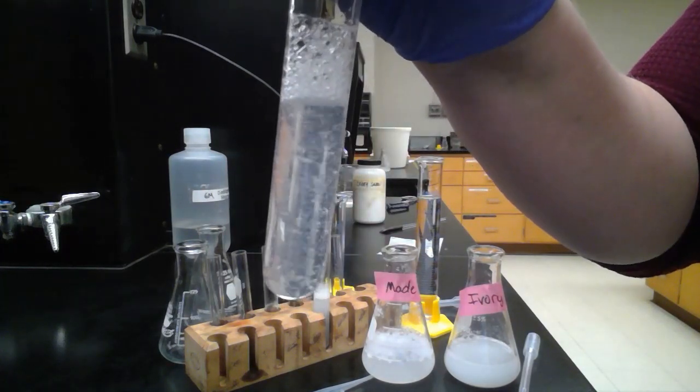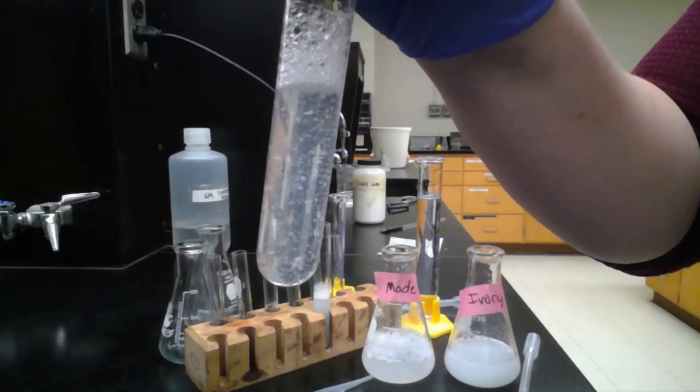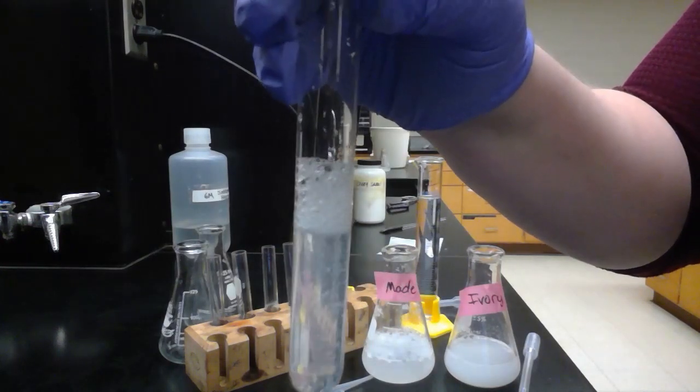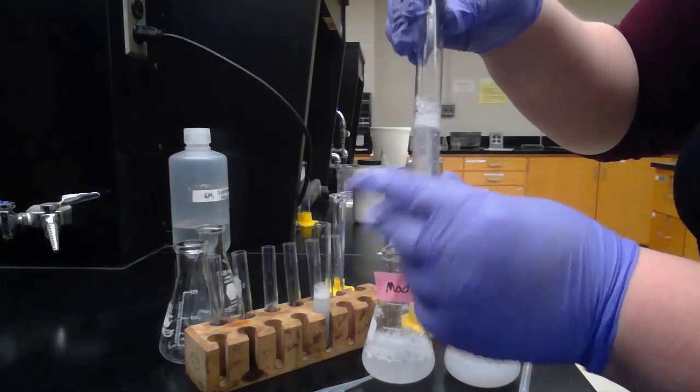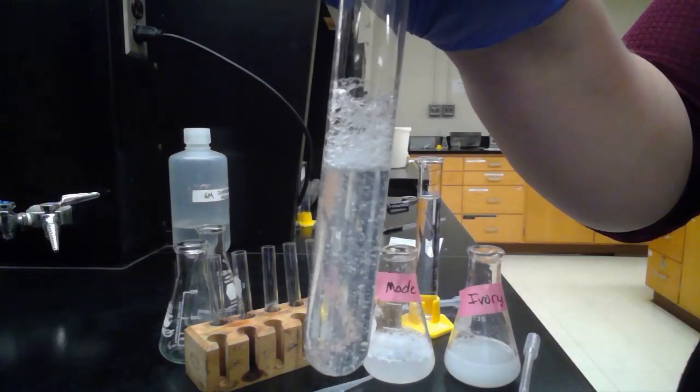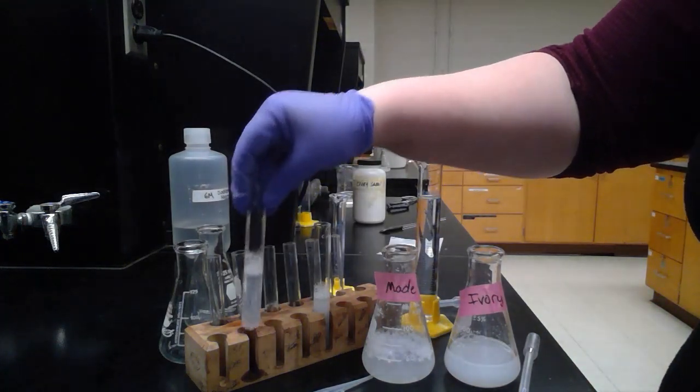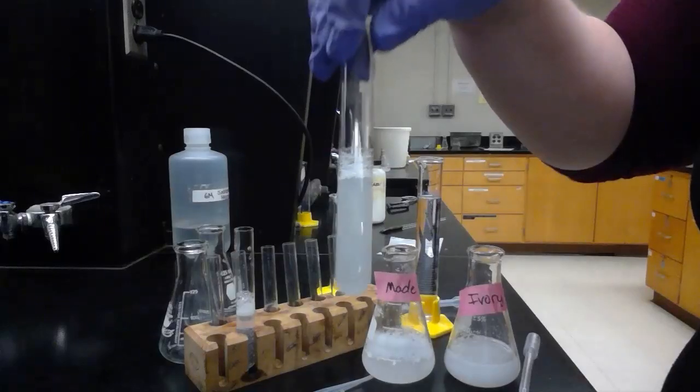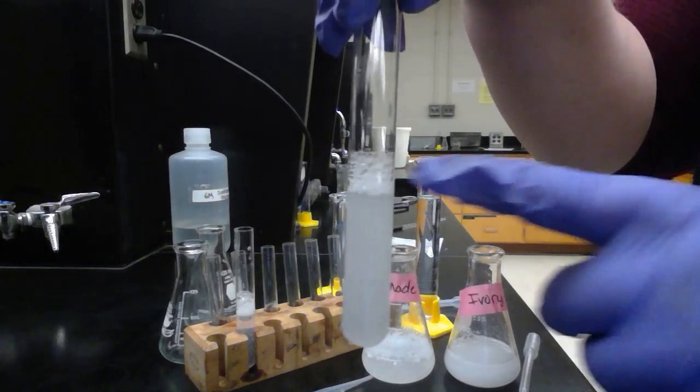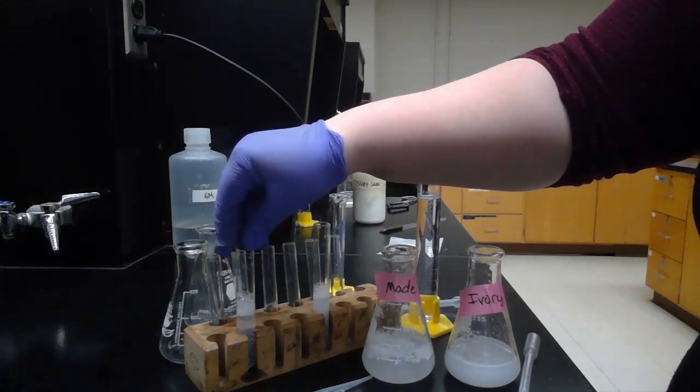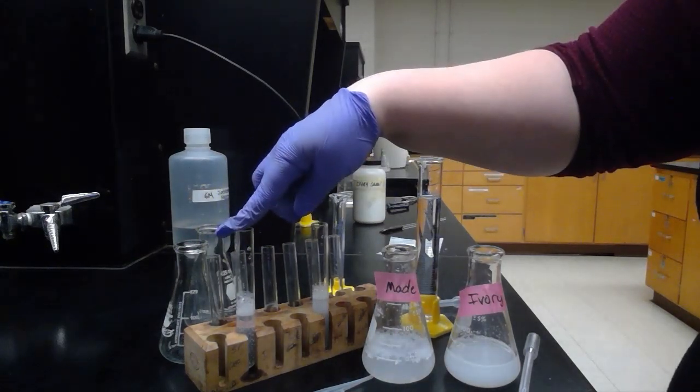We're going to shake that up as well. You can see our soap is not as well dissolved. You can see a lot of particulates. But the foam gives us maybe about the same height as our other one. Not a huge difference on foam test between our control soap and our made soap.